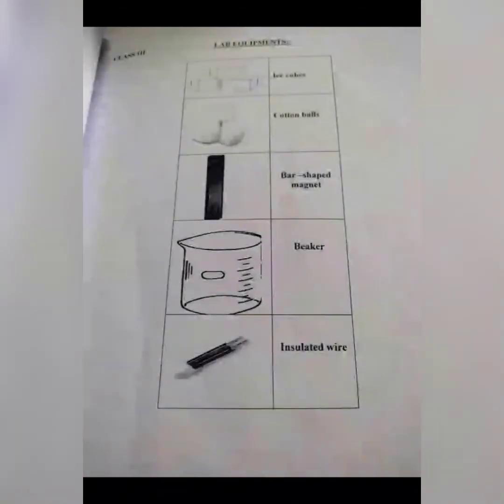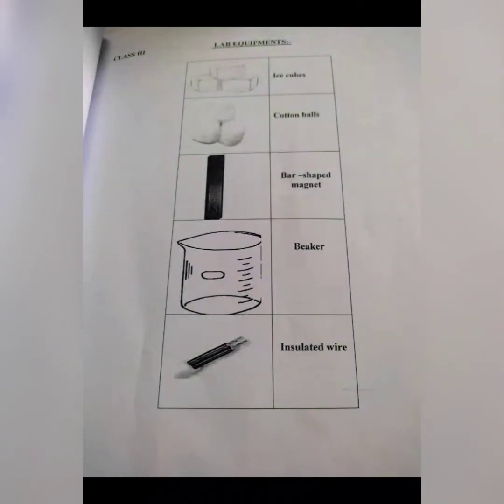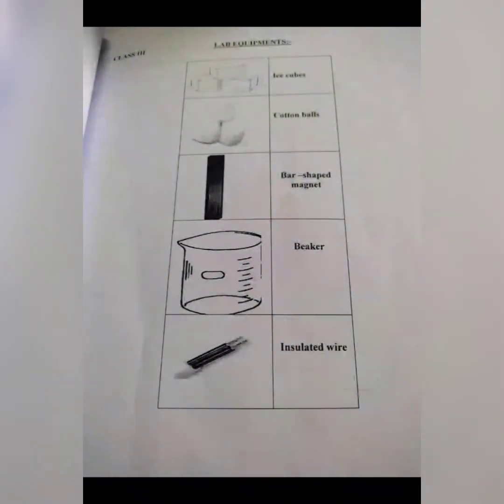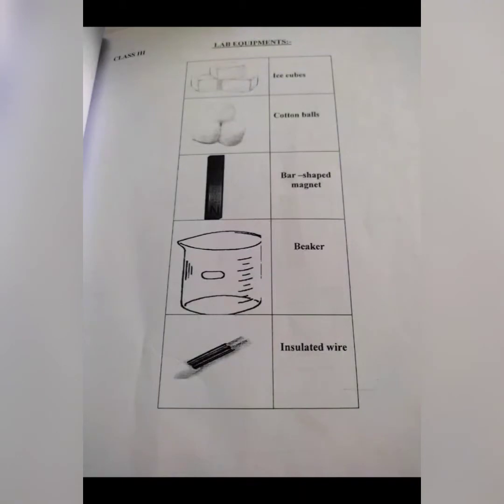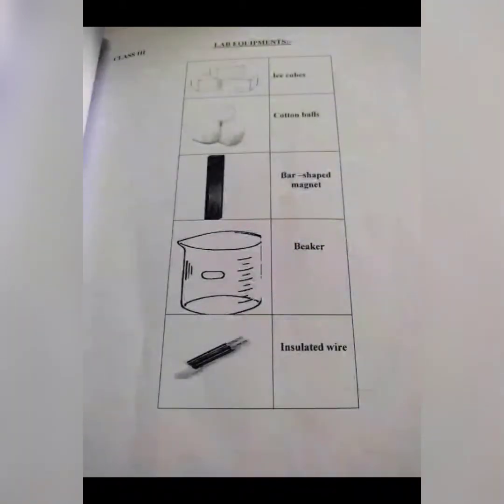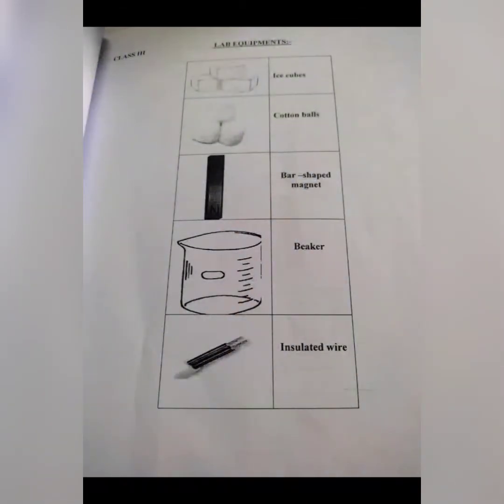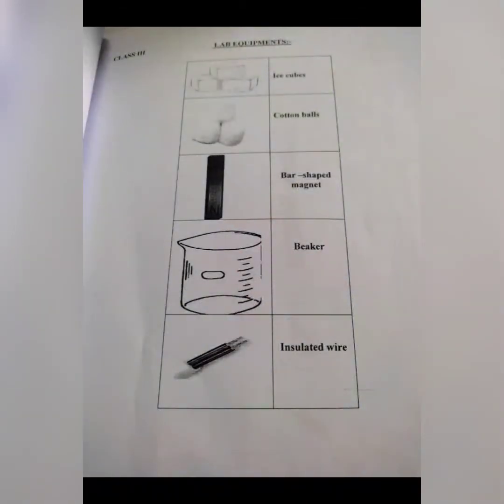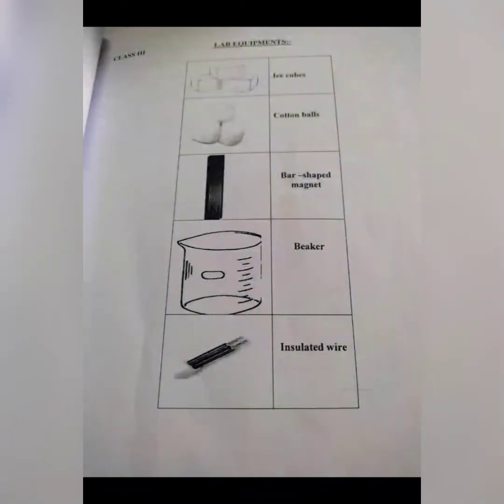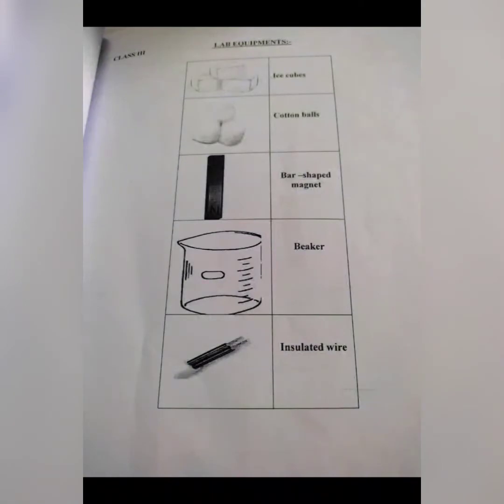Today we start a new topic, that is lab equipment. Before we start, we will know about what are lab equipment. Lab equipment are used in laboratories. We use them for calculation, balancing, and measurement of elements.